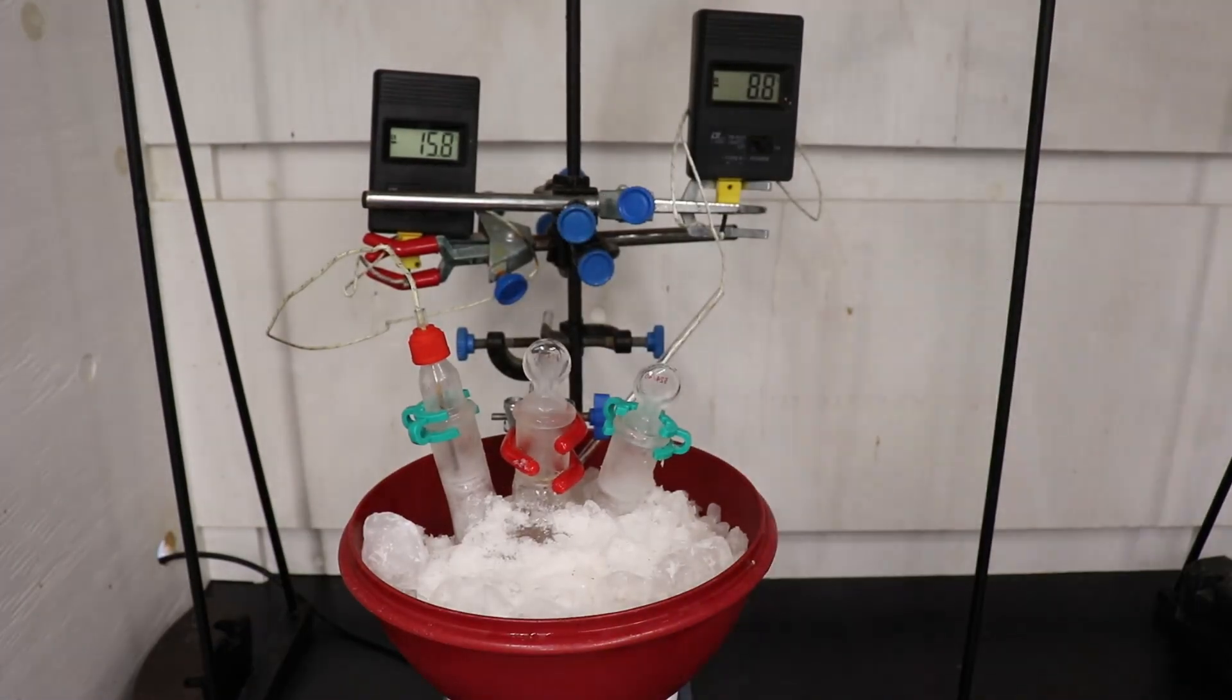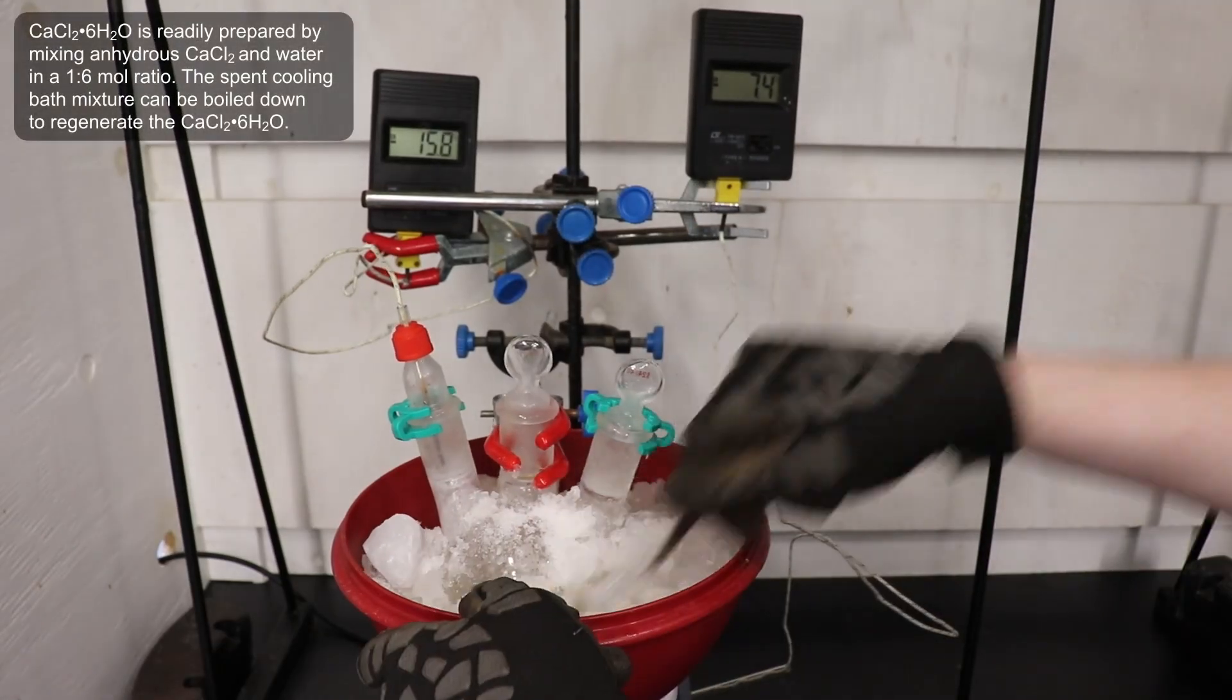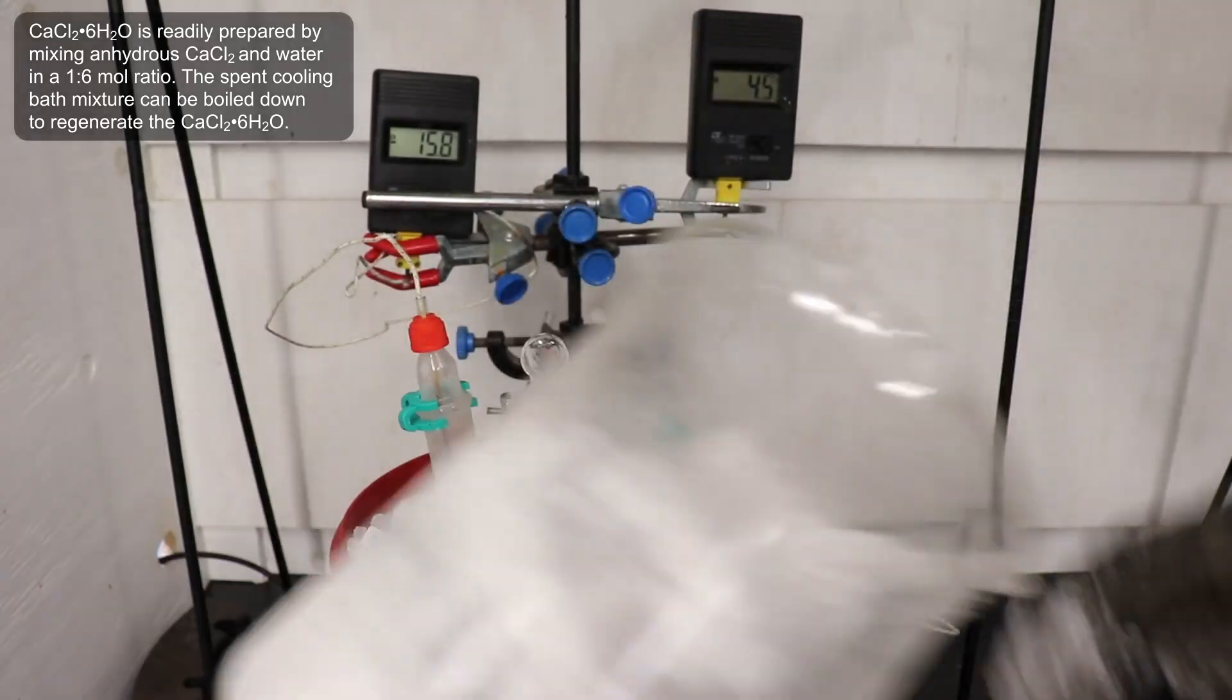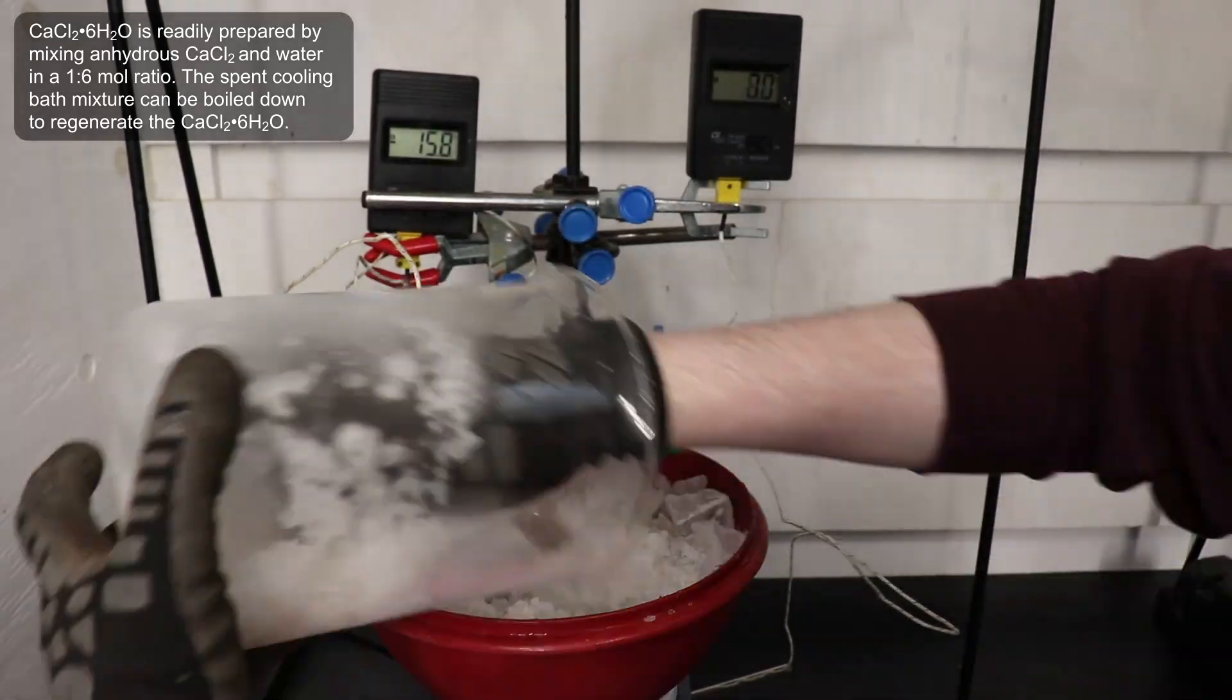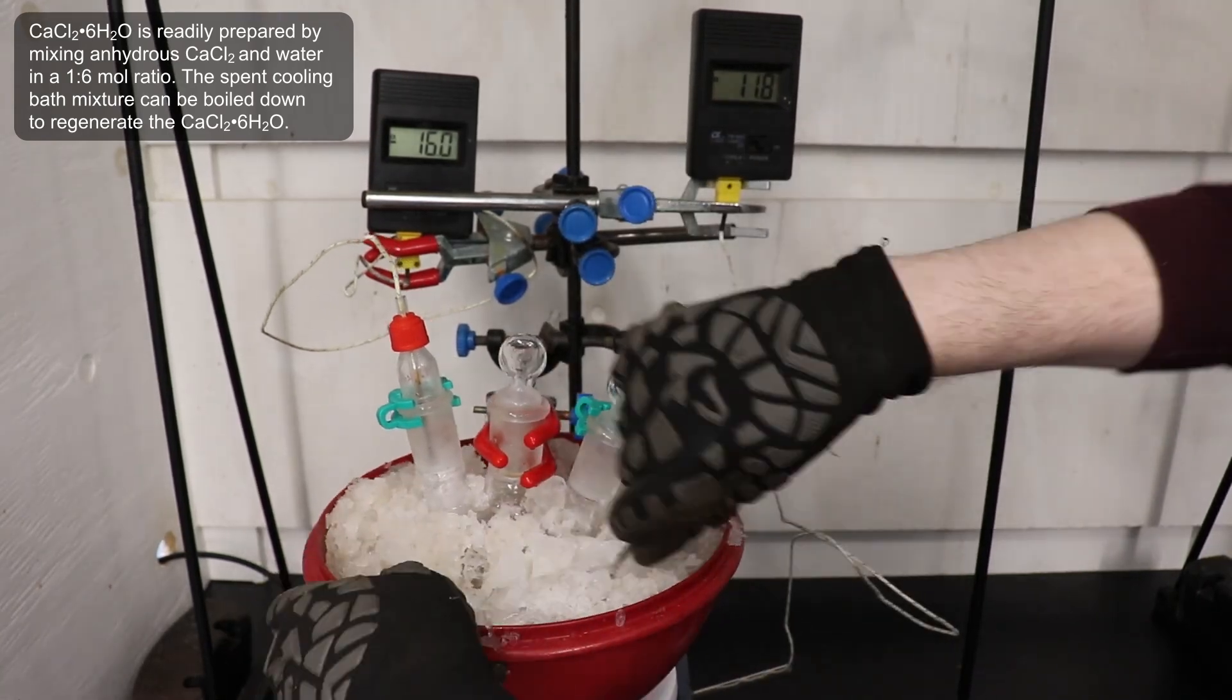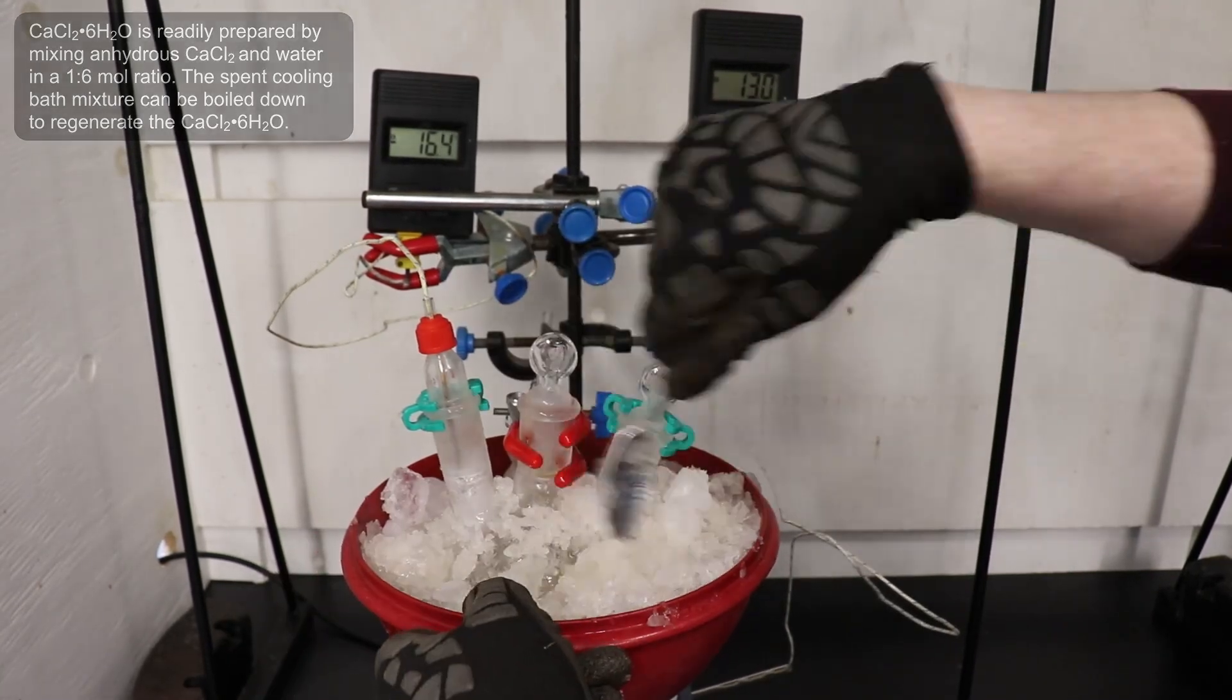This mixture can easily reach negative 30 degrees Celsius, which is far colder than a typical ice salt bath. This is particularly ideal since the diazotization reaction is highly exothermic, and efficient cooling is required to mitigate the competing decomposition reactions.